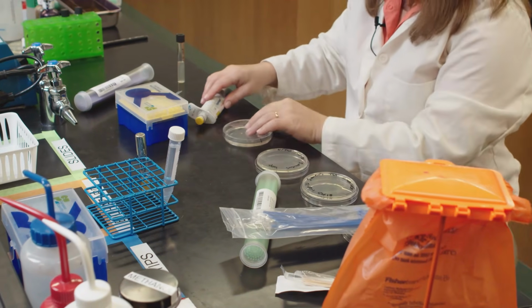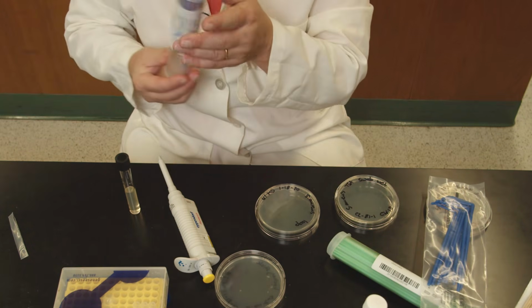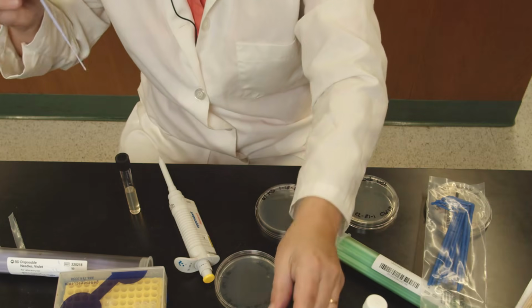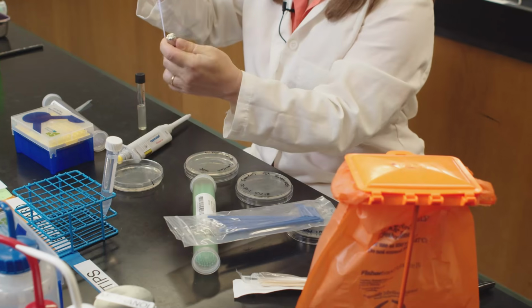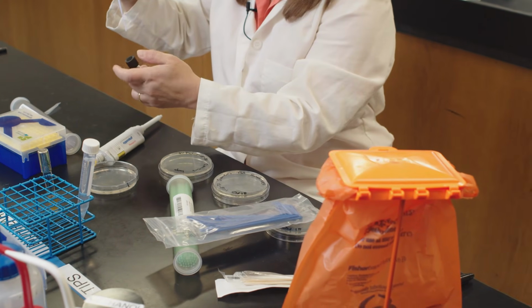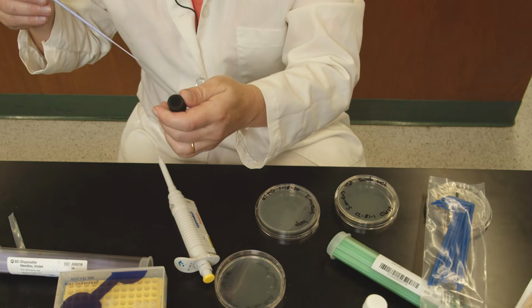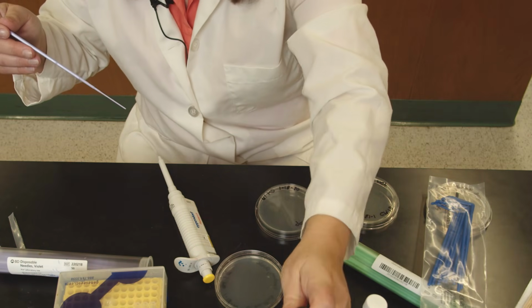One last method to show you how to inoculate agar, sterile agar, is to use a needle. So a needle is very similar to the loop, except it's very pointy. If you want to inoculate, you can take a little bit of a sample, and in this case, you open it carefully and just stab the needle into the medium. Try not to touch the walls. These are different ways of inoculating the different media.